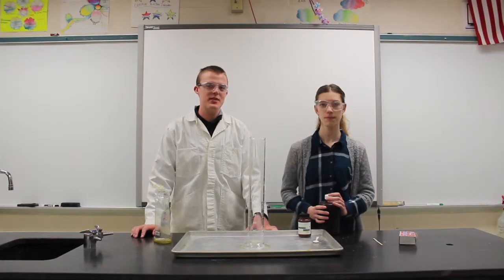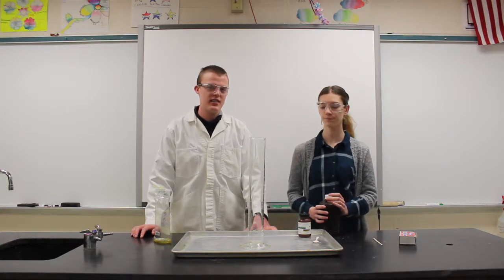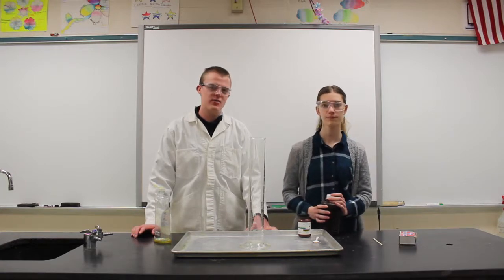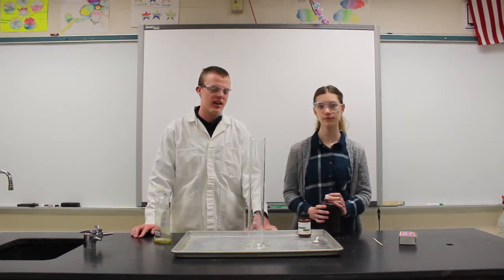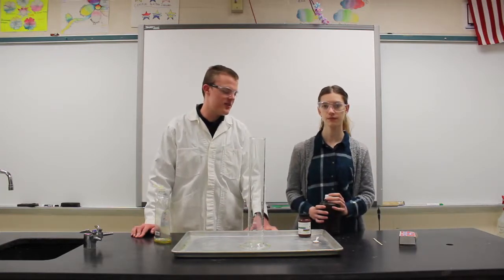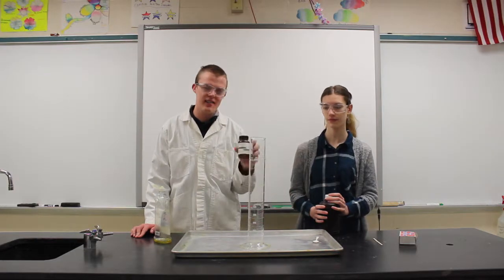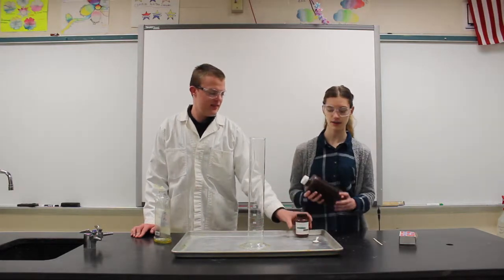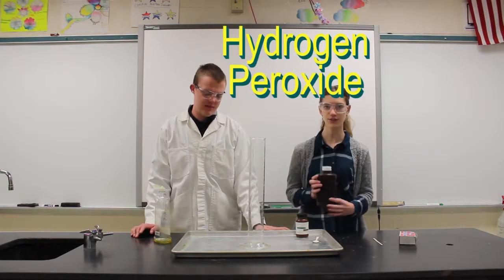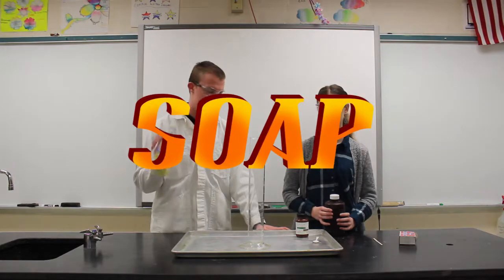Today we are going to be doing our elephant toothpaste reaction. It's a decomposition reaction of hydrogen peroxide into water and oxygen through the use of a catalyst — potassium iodide and hydrogen peroxide. We also have soap here as well.